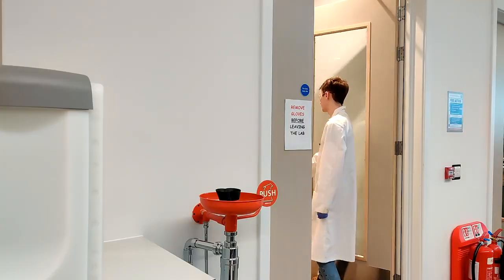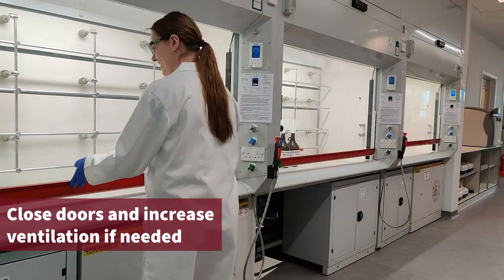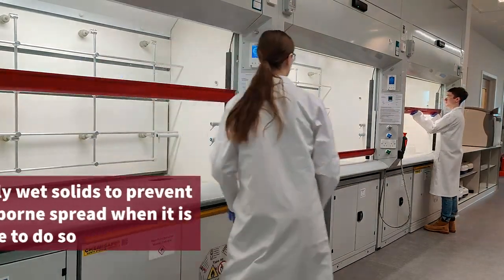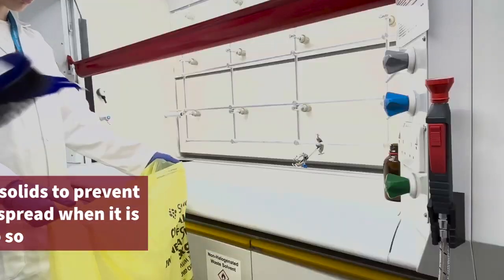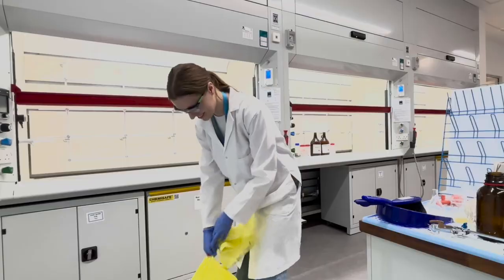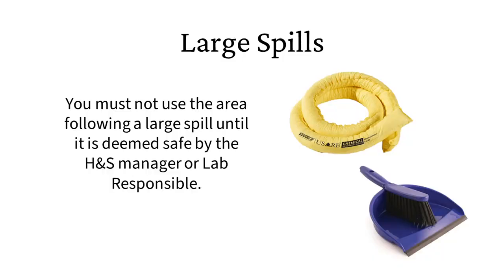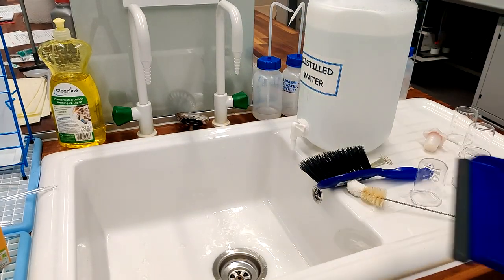If the solid spilled produces an airborne dust, close doors to prevent the spread and increase ventilation through windows and fume hoods. If appropriate, dusty solids may be wetted to prevent airborne spread, but only if it is safe to do so. The solid can then be transferred into an appropriate waste container, labelled, and taken to chemistry stores for disposal. The area should not be used until deemed safe by the lab responsible or health and safety manager. Remember to clean or replace items used from the spill kit.